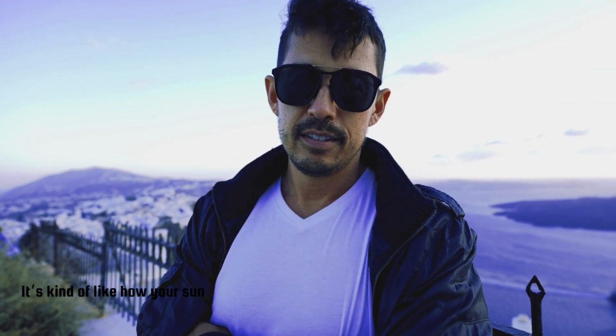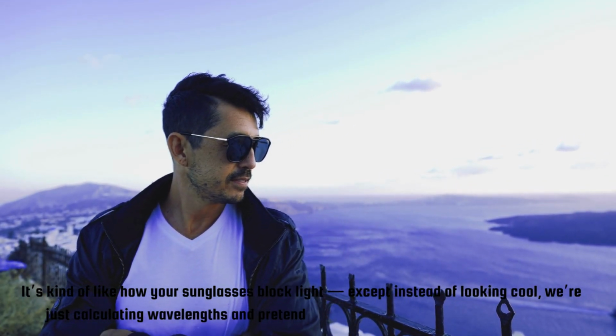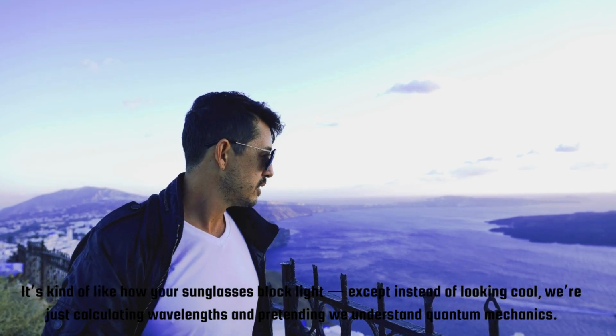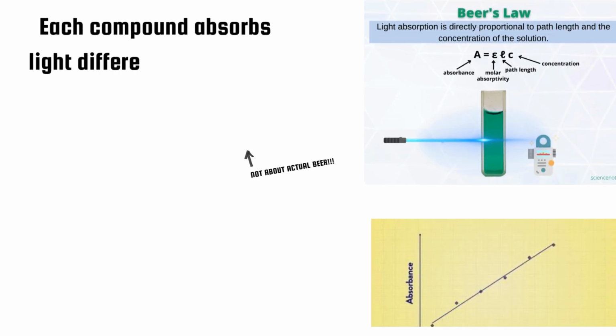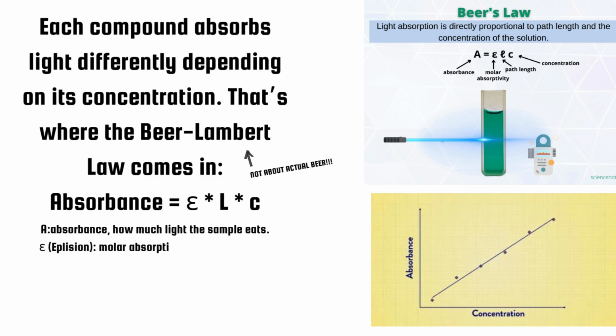It's kind of like how your sunglasses block light, except instead of looking cool, we're just calculating wavelengths and pretending we understand quantum mechanics. Each compound absorbs light differently depending on its concentration. That's where the Beer-Lambert law comes in.